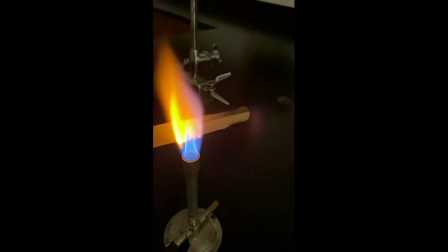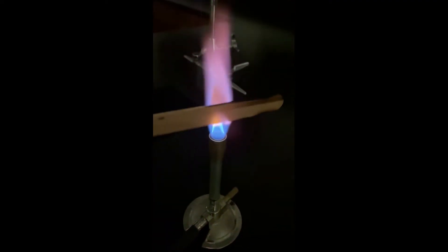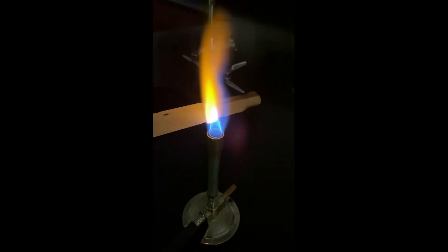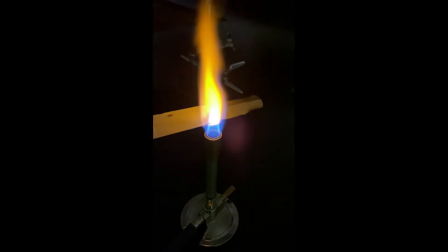Grab your next one. Make sure you tap it off, get the extra off of it so it doesn't drip in your Bunsen burner, and then put it right over the flame. You can see that we are working with a very tight blue flame in our Bunsen burner.